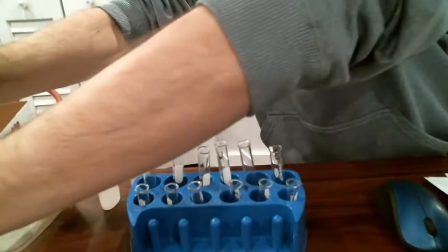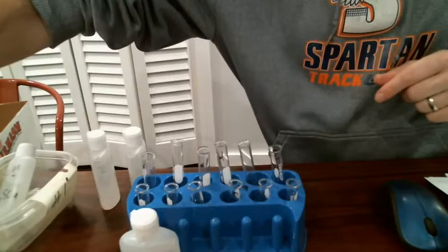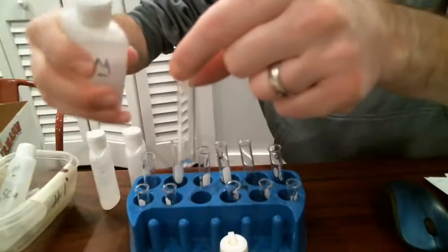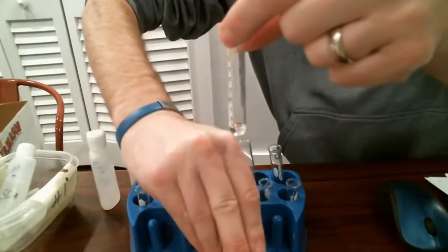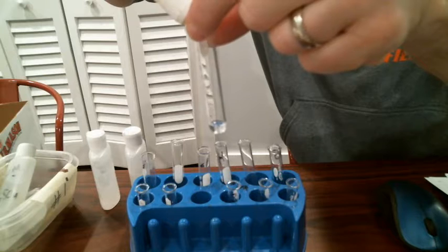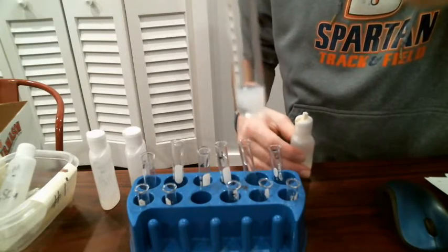And then finally for this last one, part number four, we have cadmium chloride and we have sodium sulfide. I think the first one, let's add our cadmium chloride. Make sure we can see this. Boom, boom, cadmium chloride goes in, and here comes our sodium sulfide. And you notice color change and the formation of that solid precipitate.